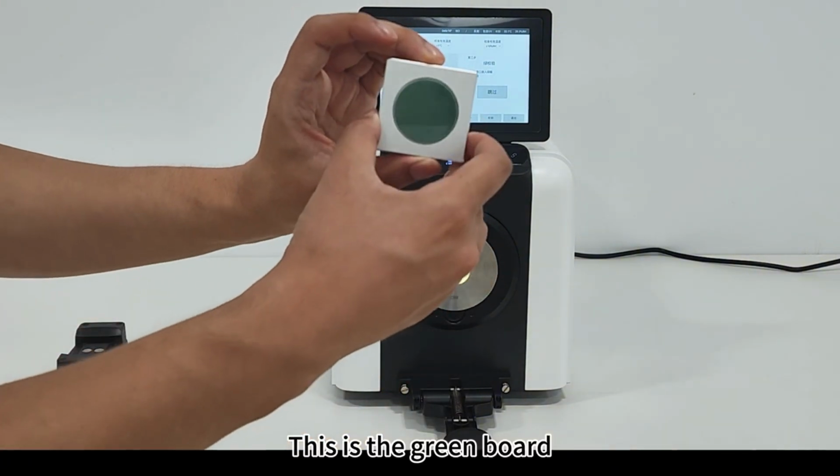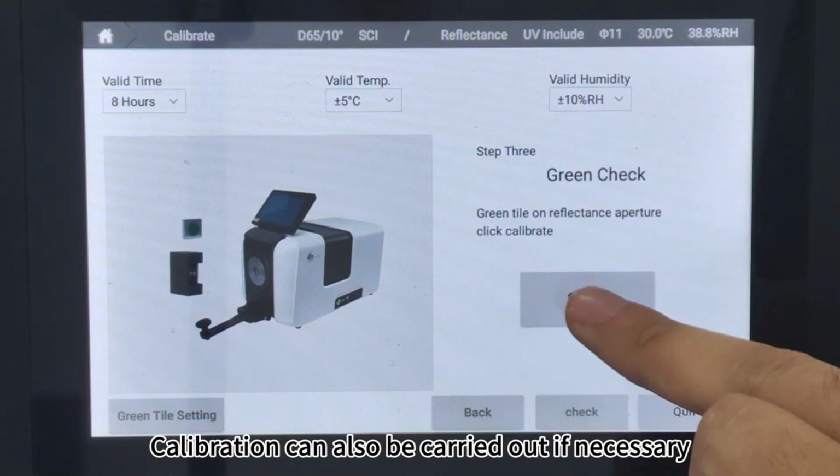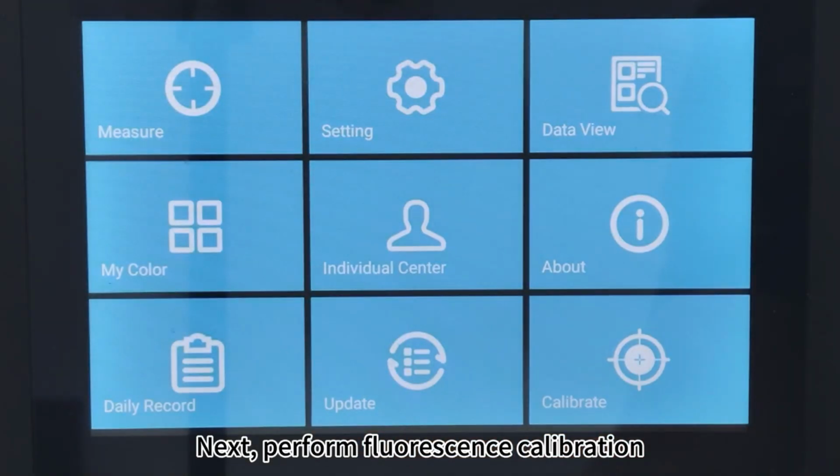This is the green board. Generally, skip the green check option. Calibration can also be carried out if necessary. Next, perform fluorescence calibration.